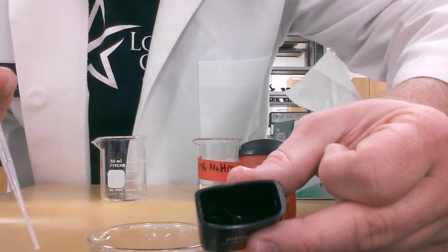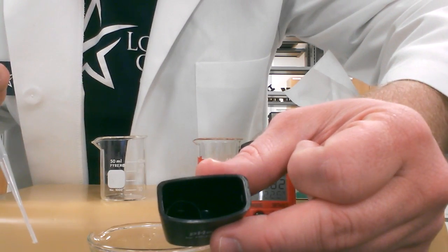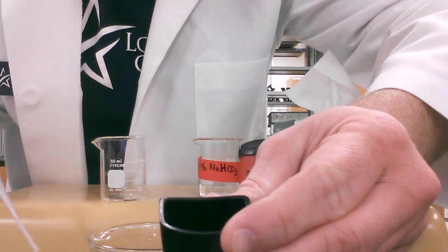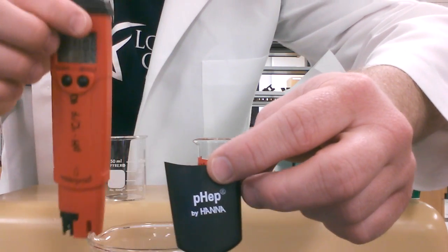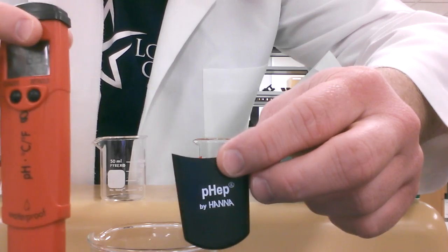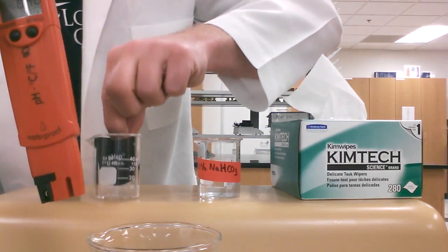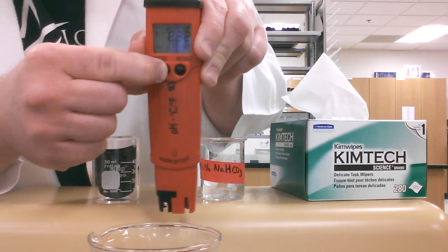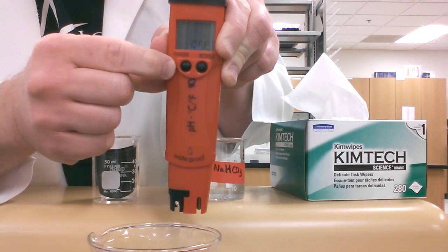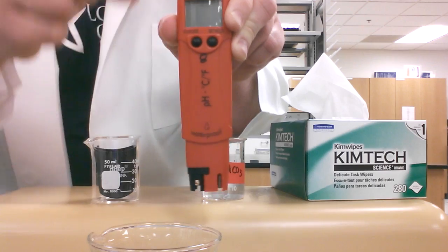Inside this cap there is a small cylinder or circle. We're going to pipette the solution down in there. You may or may not be able to see that, but when you're doing this, look in there and you'll see it. Once you've done that, once that solution is in there, we're ready to put the pH meter back in there. We're going to hold the power button for one full second again till it says off. There we go.